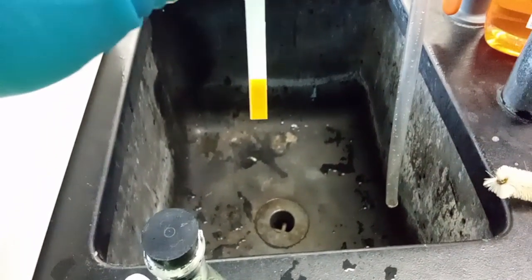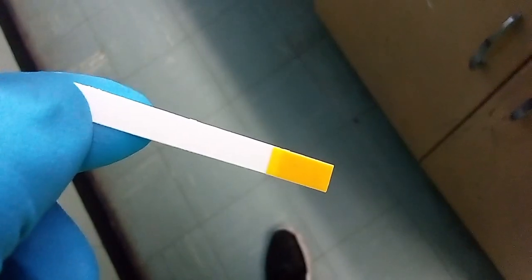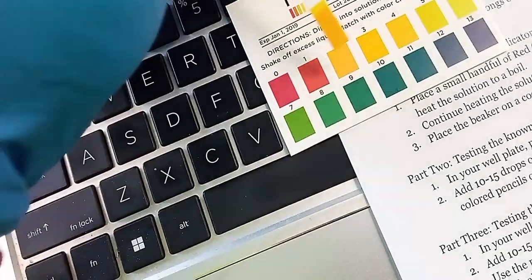The first one is going to be vinegar. So we're going to measure the pH. You should be able to see a color change. And right now we're getting an intense color change. I know the light doesn't help in there. It's very orangey. Right there, it's a good color. Like a witch. Right there, yep, it's an orange color, very orange. So when you go to the chart, you look at this, and the orange color tells me that this has a pH of about 2. Compared against the chart, yeah, it's about a 2.